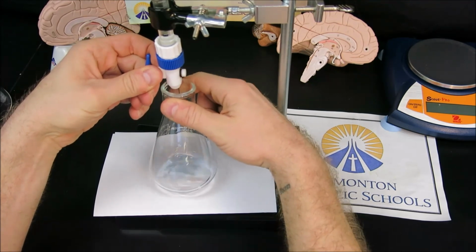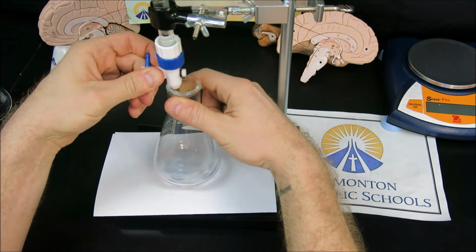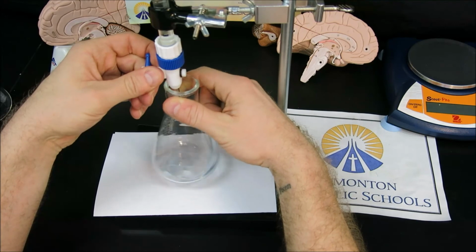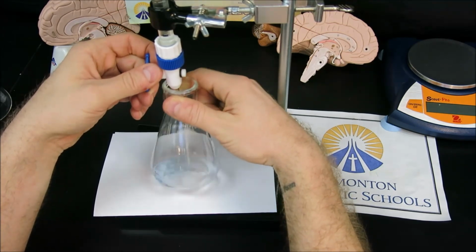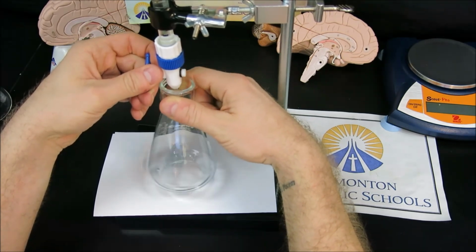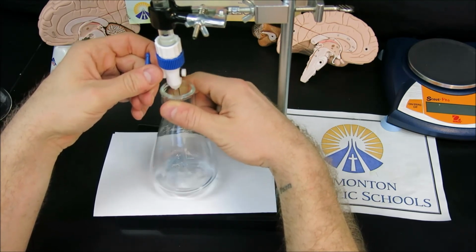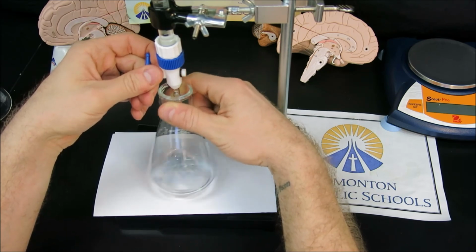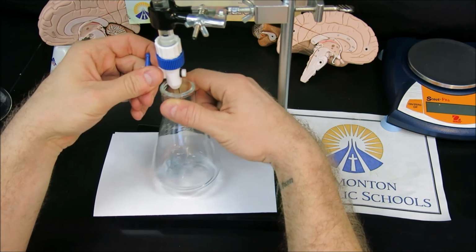The difficulty in titration is that it is a two-handed process, with my left hand in this case operating the stopcock to control the flow, and my right hand swirling all the time in order to mix my two reactants. I'm using 3 fingers to do that: 2 fingers grasping the neck, and my third finger providing the swirling motion. And we want just a drip at a time, very, very slow, because the color change could occur with just a single drop of titrant, and we don't know exactly how much titrant that will be.